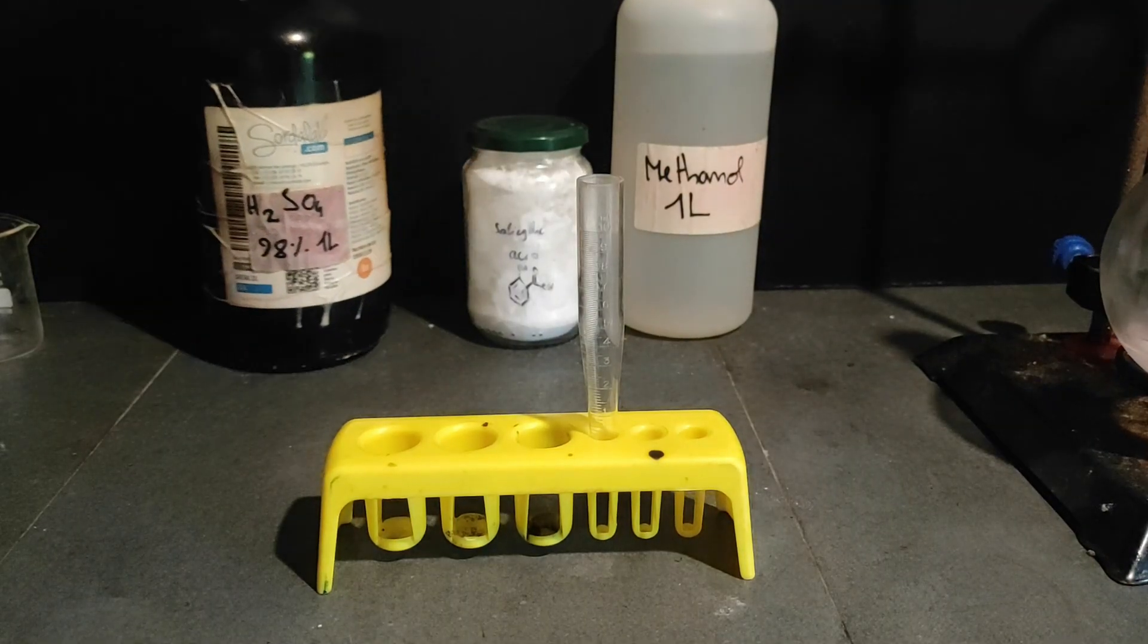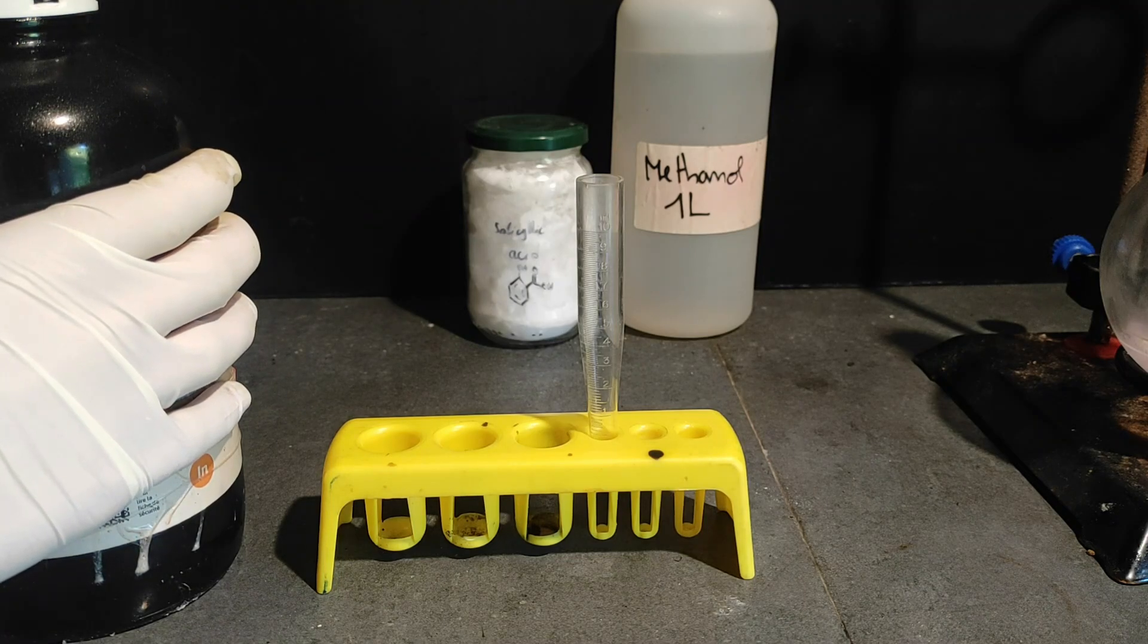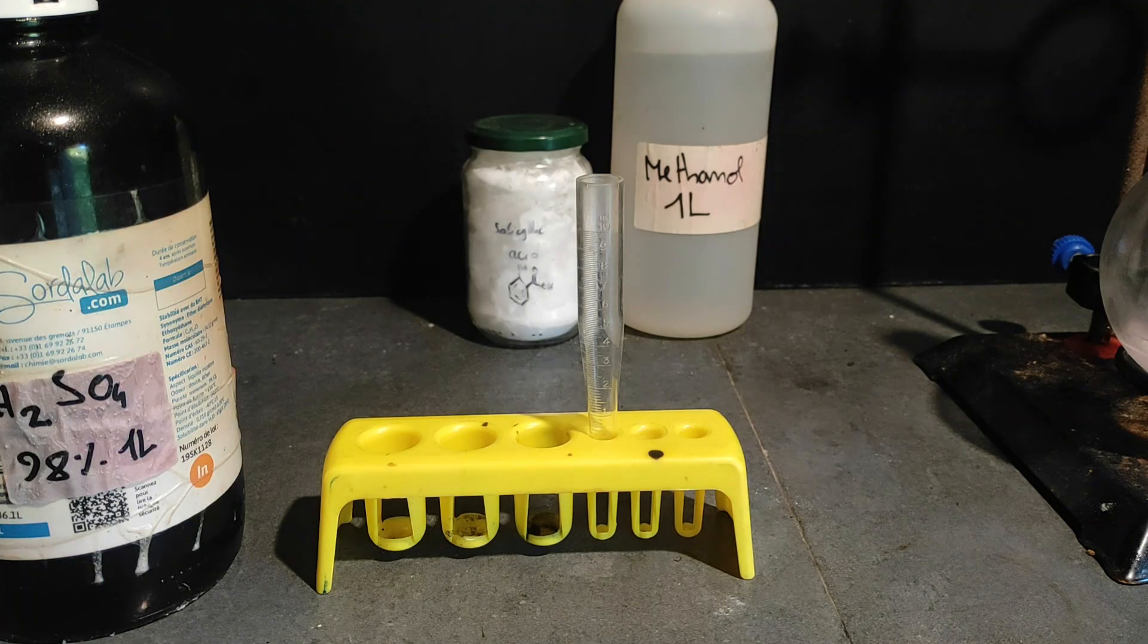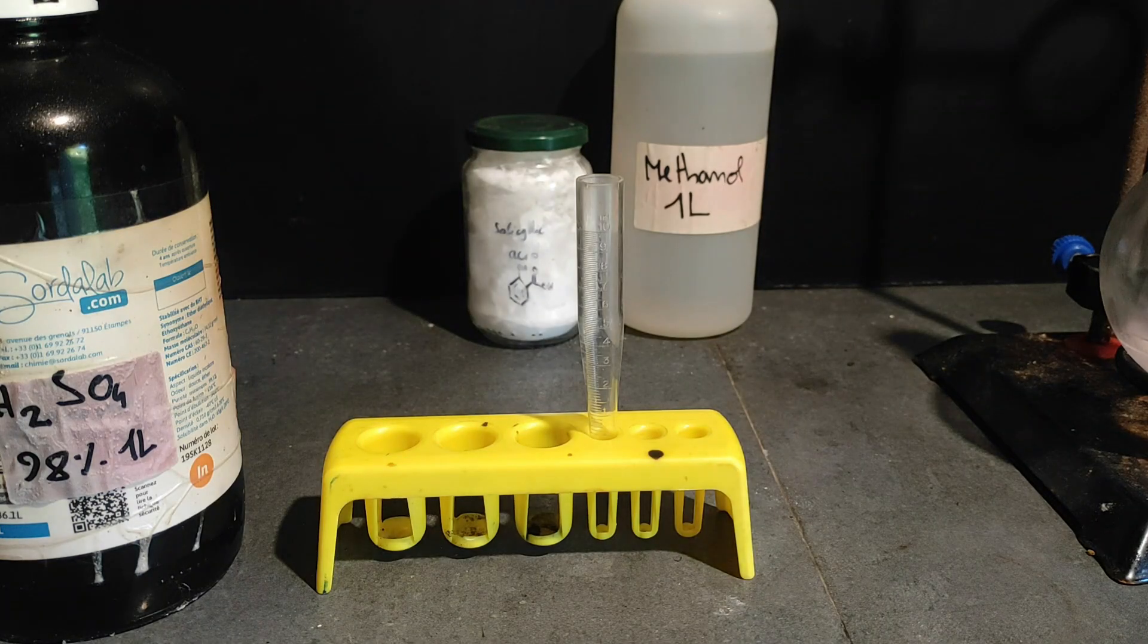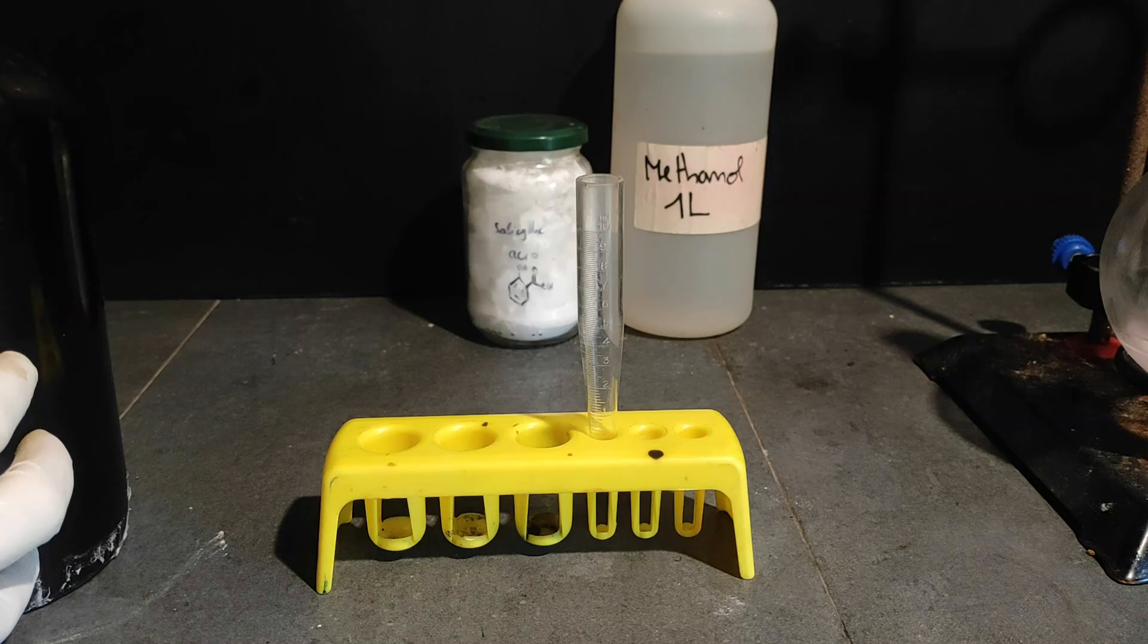And finally to make the reaction work, we will need what is called a catalyst. It's not a reagent but if we don't add any the reaction will take years or not even work sometimes. Our catalyst for this reaction is concentrated sulfuric acid and we need approximately 5 milliliters of it.